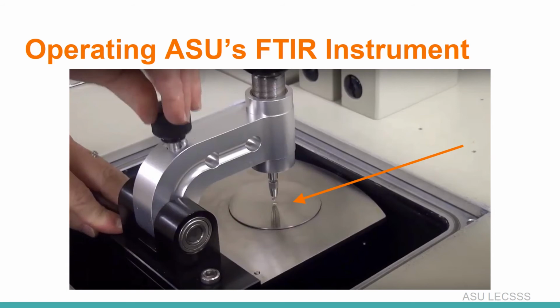Then you can place the puck on the sample with the arm to hold it in place and twist and screw the knob down again and close the lid and evacuate the system. Remember, this is your Scotch tape, so you should be smart enough to know the magical chemical bonding structures in Scotch tape to note in the spectrum that is going to be returned to you, so you can use that to analyze your unknown sample if you have it.